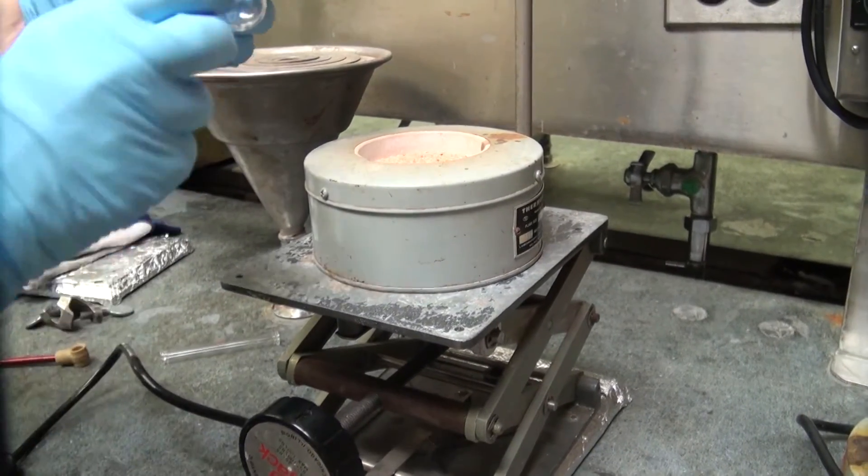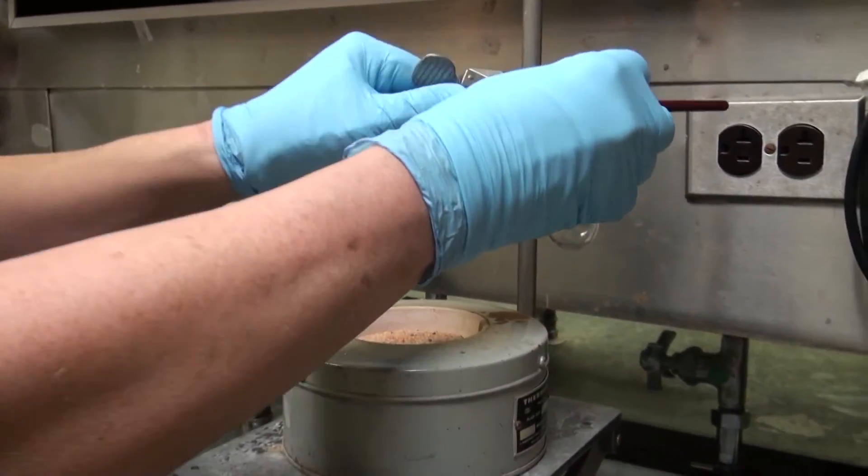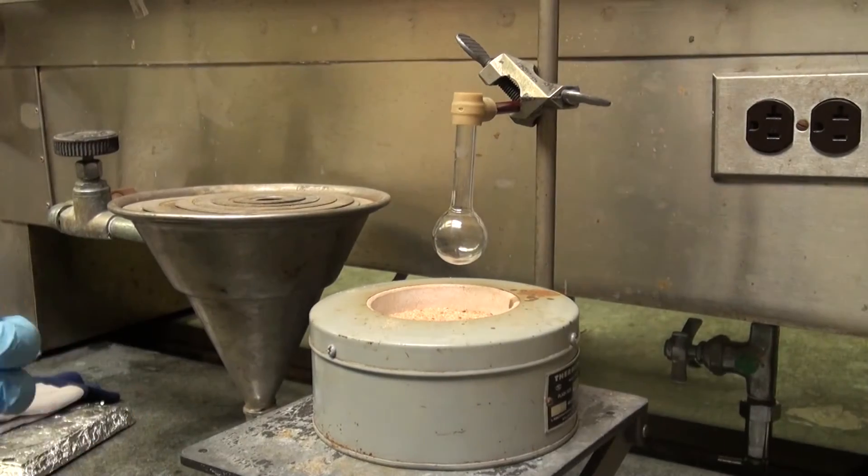Now for the apparatus you need a flask and you need the connection. You can clamp it to the stand and you want to have a condenser.